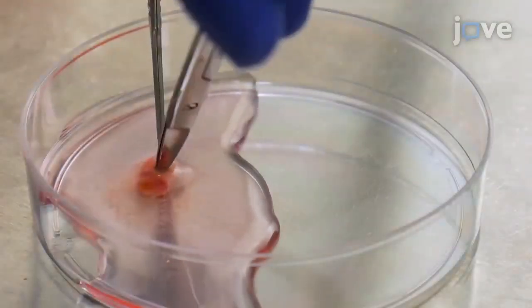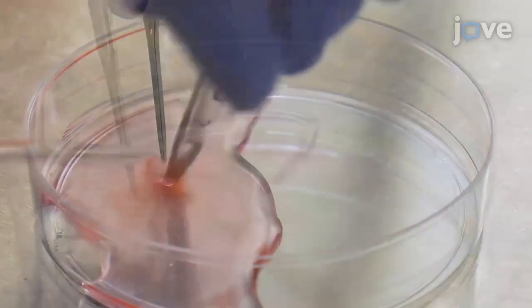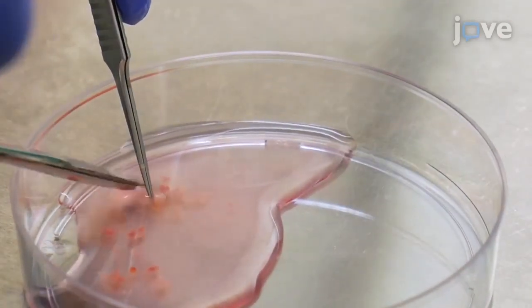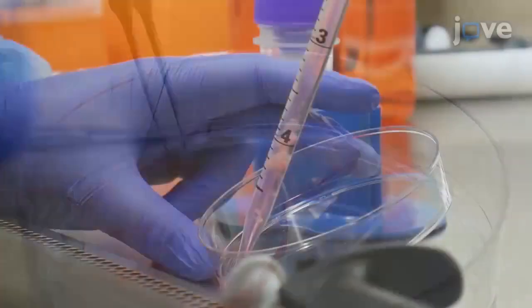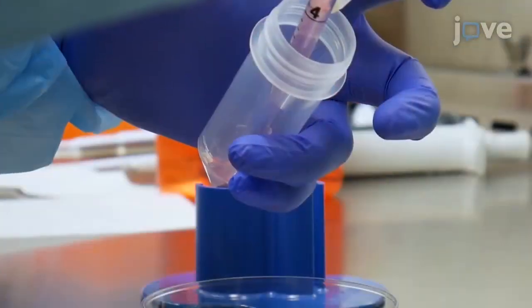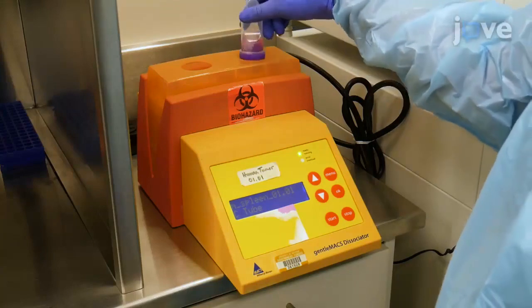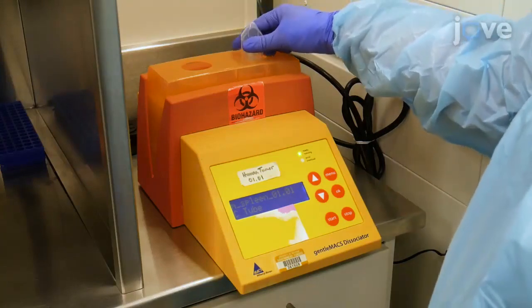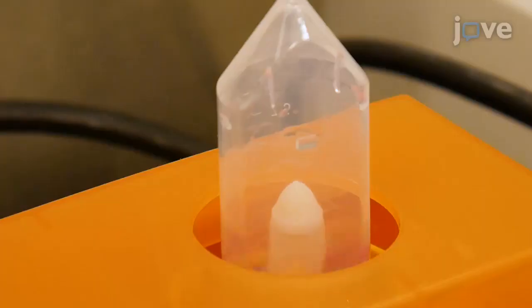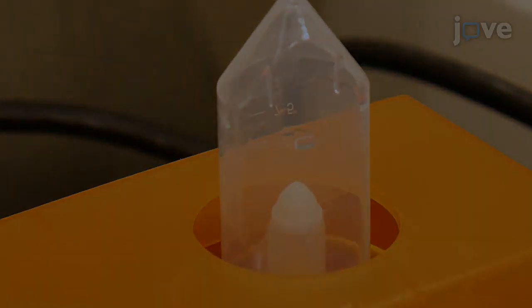Then use scissors and tissue forceps to mince the tumor into small pieces of 2 to 4 millimeters. Pipet the tumor mixture into a dissociator tube and close the tube. Invert the tube, attach onto the sleeve of a tissue dissociator, and dissociate the tissue using the appropriate program.